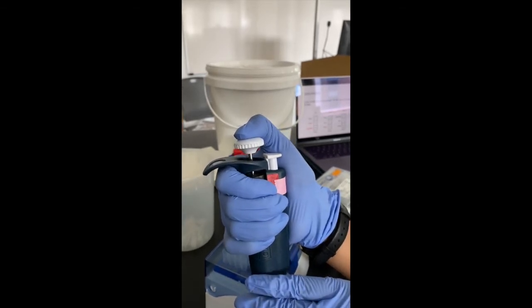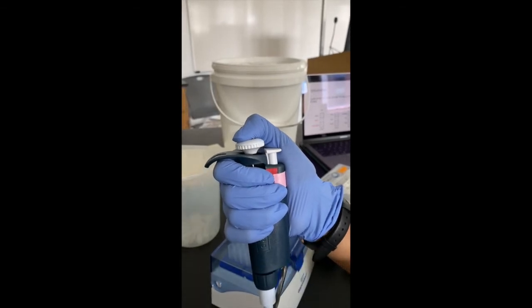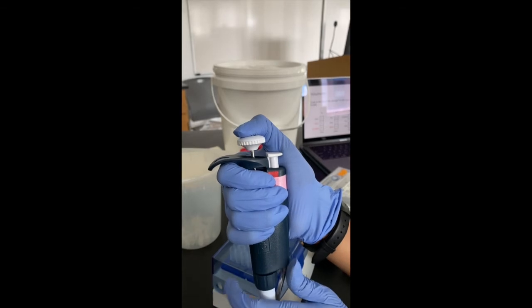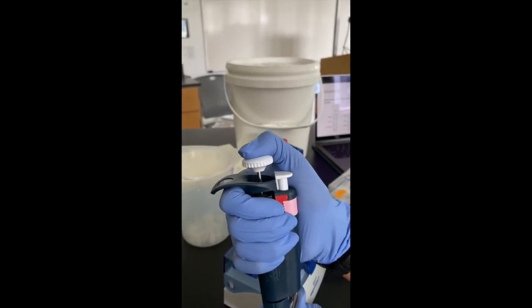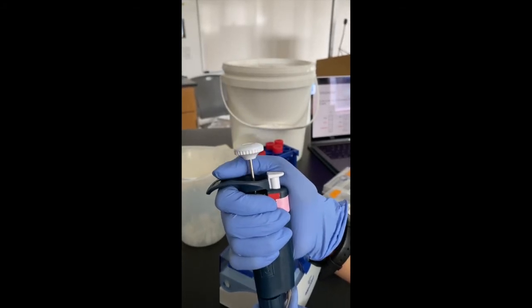And when you do so, you will notice that you can push it along a little bit further, and you will encounter a second set of resistance. That's called the second stop. So this is the state of rest. You apply pressure, first stop, apply a bit more pressure, second stop. This is how a plunger works.